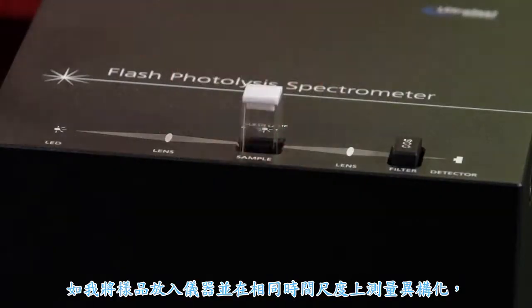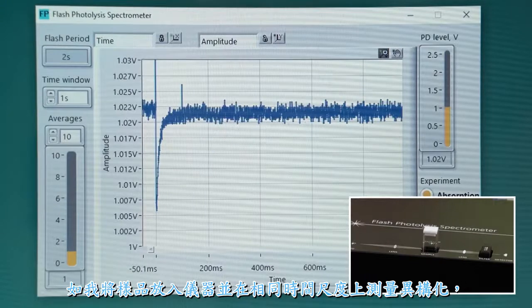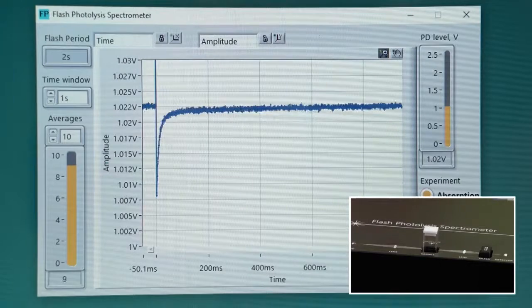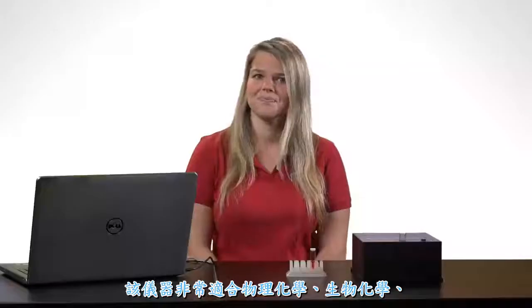If I put that sample in the instrument and measure the isomerization on the same time scale, you'll see that it happens much faster. In fact, it happens in less than 100 milliseconds.